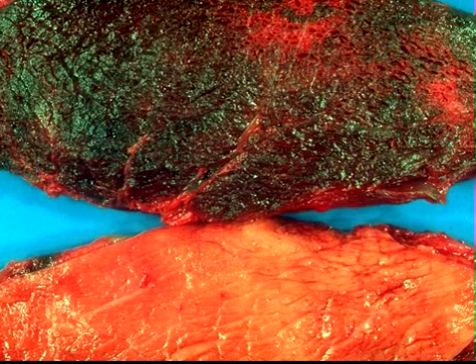Slide number 4 is tissue from an ox. How about a morphologic diagnosis, a cause, and name another site where you might find a similar lesion? Okay, pens down. The morphologic diagnosis is multifocal to coalescing, necrohemorrhagic rhabdomyositis with emphysema for full credit.